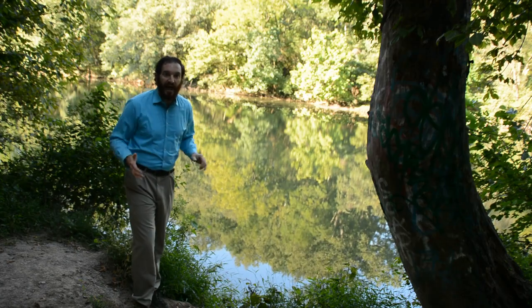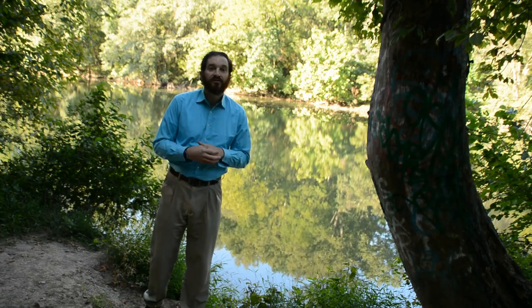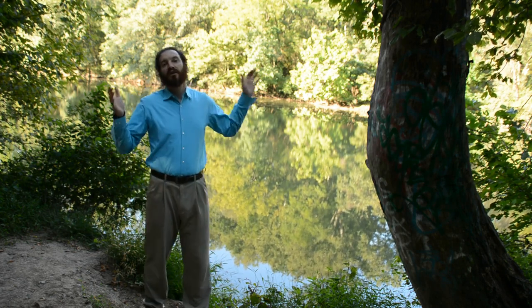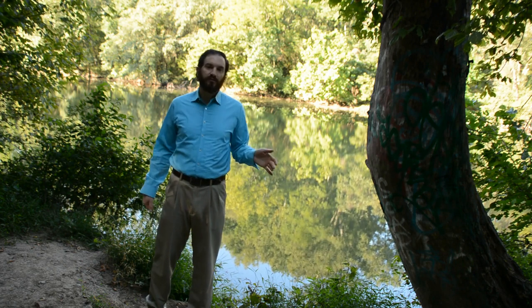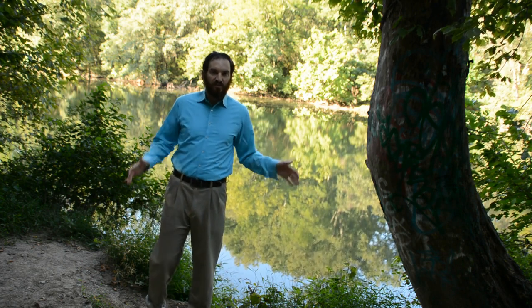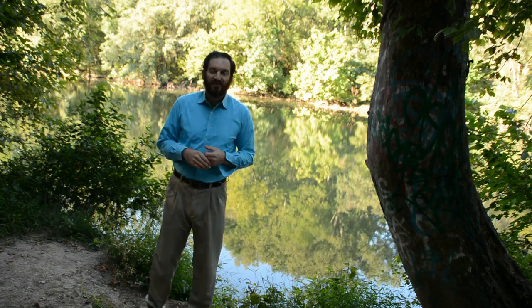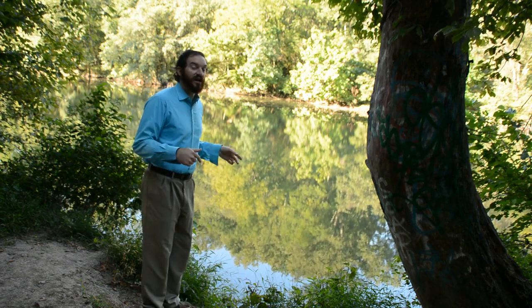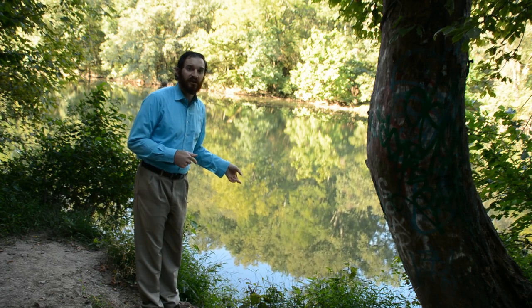Alright, so here we are back at the site where we left the primary productivity lab. It's been sitting for 24 hours. We had plenty of sun. I know it looks very similar to yesterday's video, but I promise you this is just the same time of the day I'm coming out here to work on this. So what I'm going to do now is retrieve the rig and the apparatus.